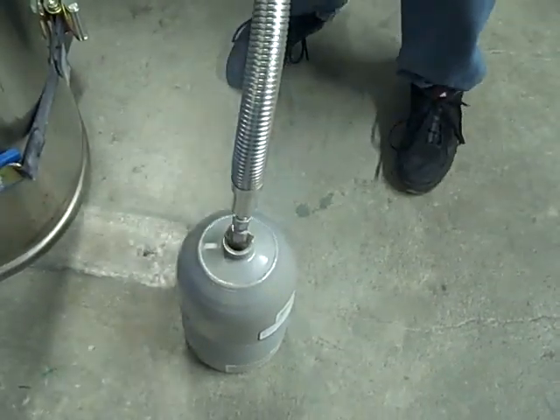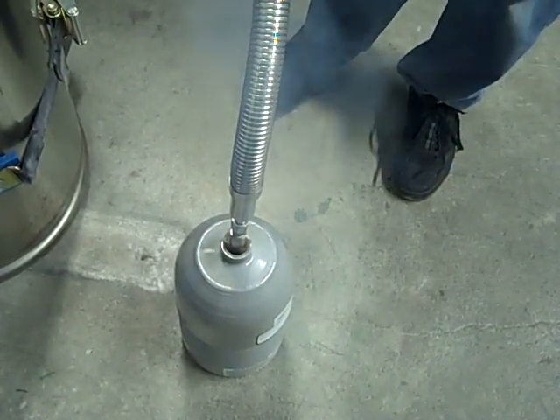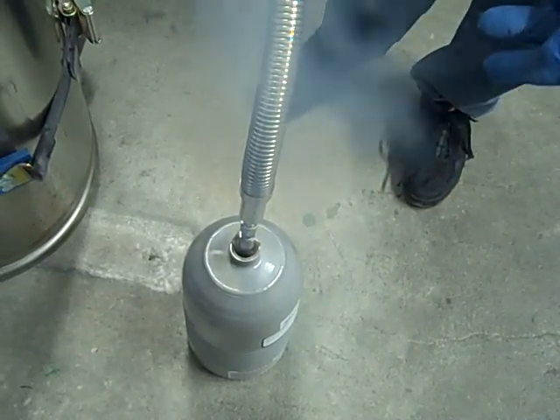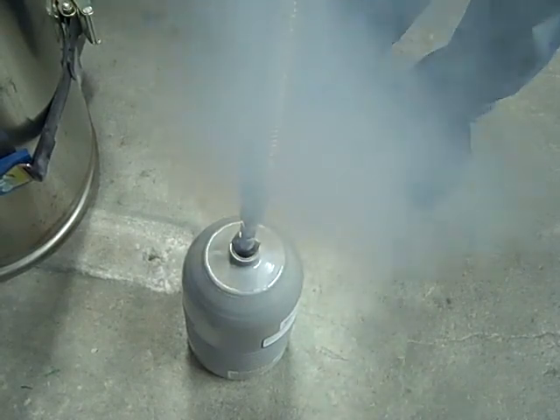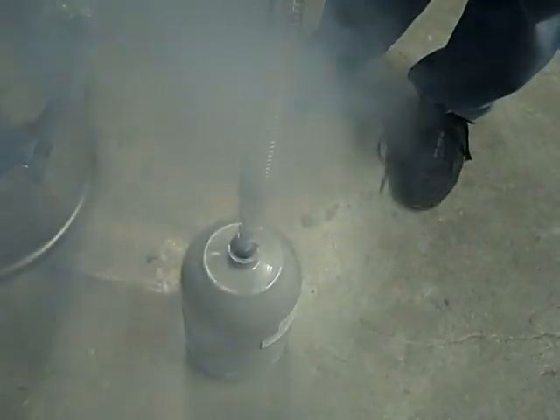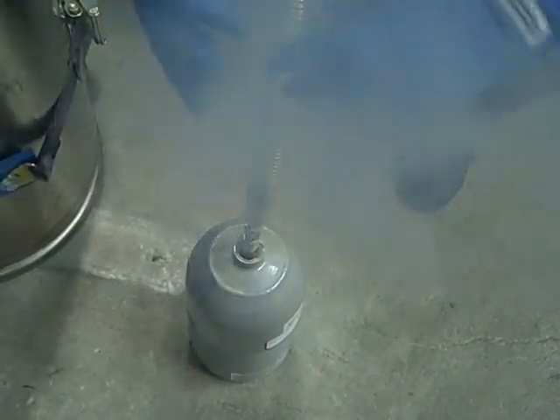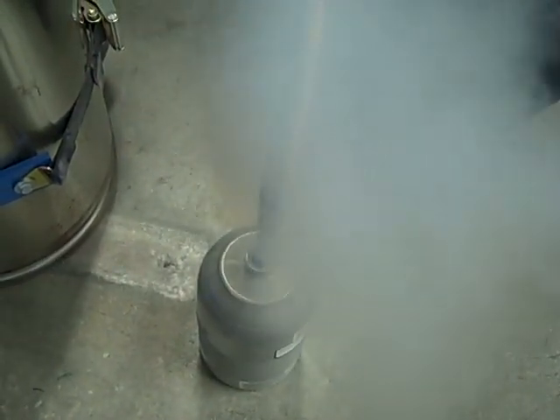What you'll see down here is that gas is starting to flow. At first it'll be warm gas because all of this is cooling down, so the gas coming up is still fairly warm — cold to the touch, of course, but relatively warm compared to the liquid nitrogen. As this gets fuller and fuller and as liquid nitrogen starts flowing, you'll see the gas get denser and eventually start to flow over the sides. We'll be watching for this, and when it starts to overflow just a little bit, that's when we know it's completely full.